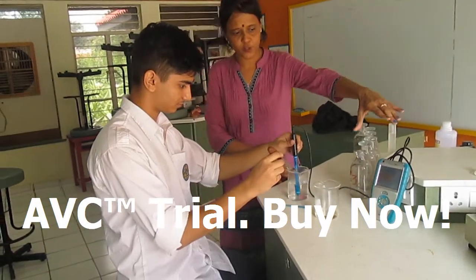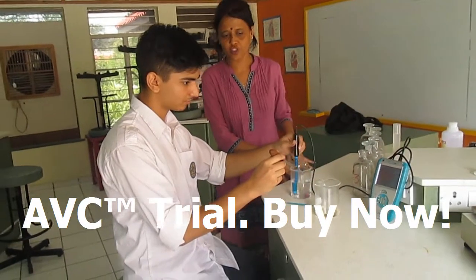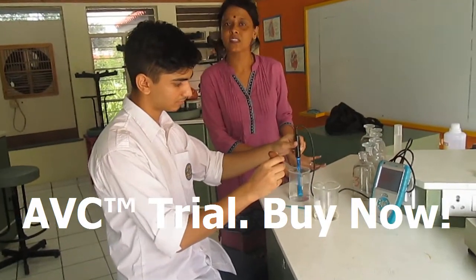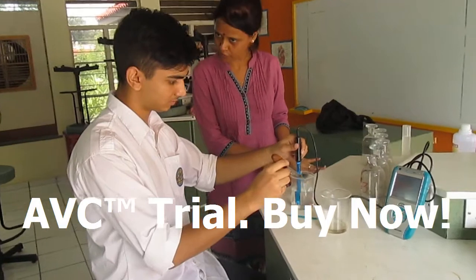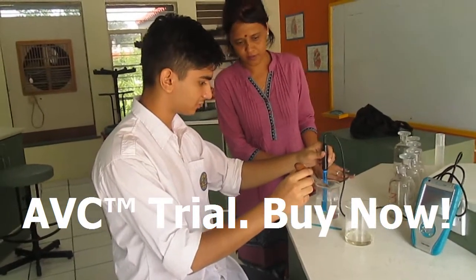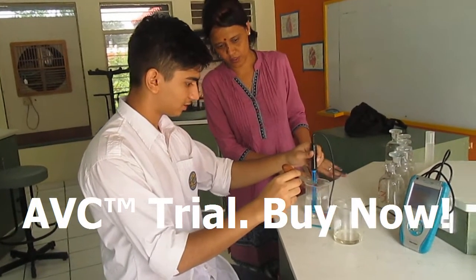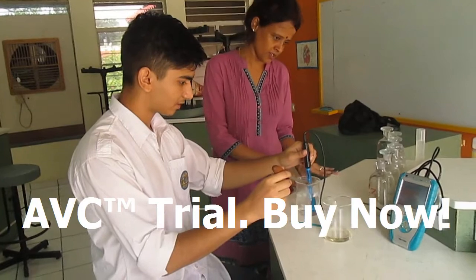He is using a pH probe for his experiment on germination of seeds. Effect of pH on the germination of seeds. So what are you trying to make here?